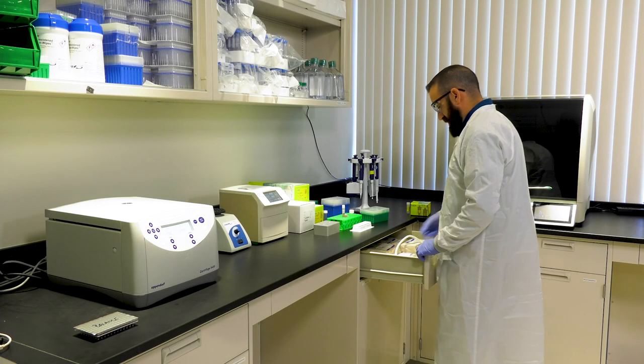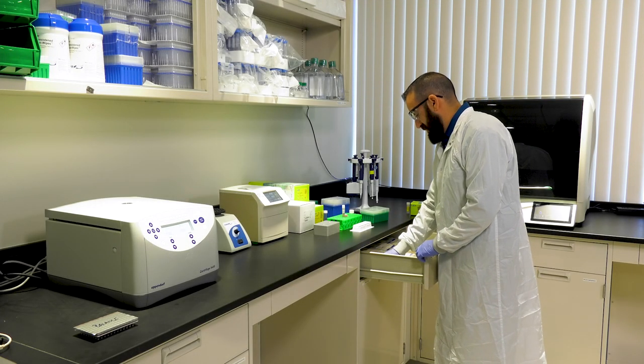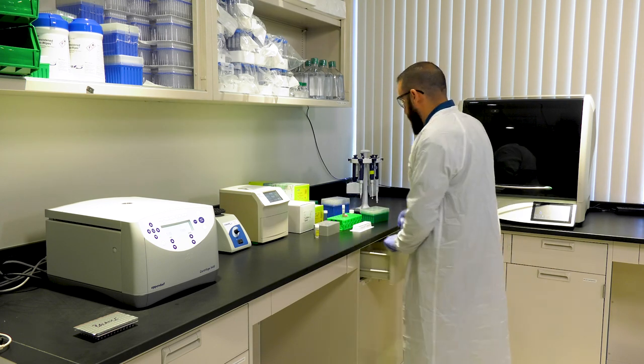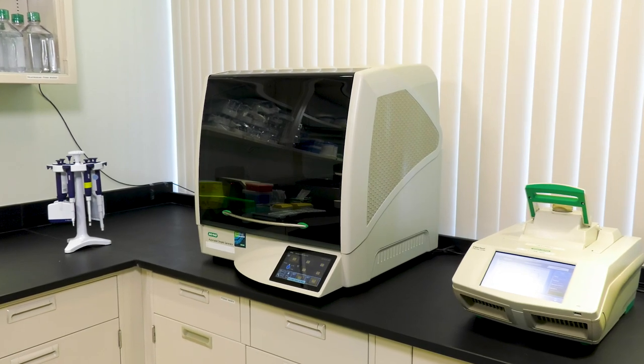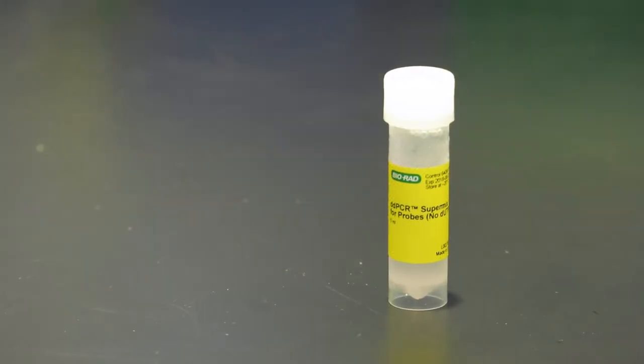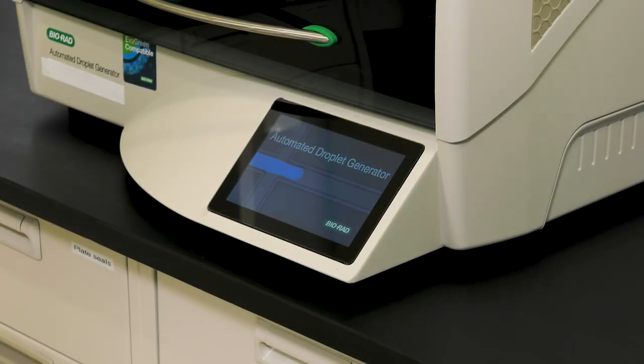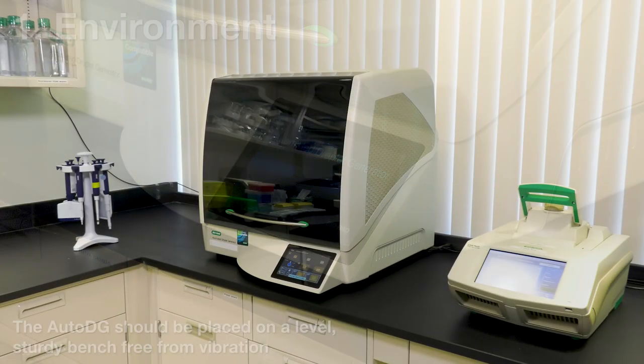This video will show you how to properly operate and provide quick workflow tips for the automated droplet generator AutoDG instrument. We're going to talk about environment, sample preparation, plate sealing, vortexing, centrifuging, and AutoDG setup.